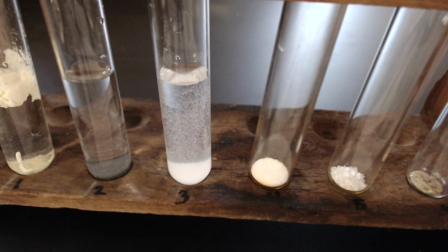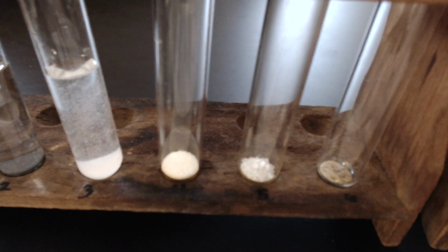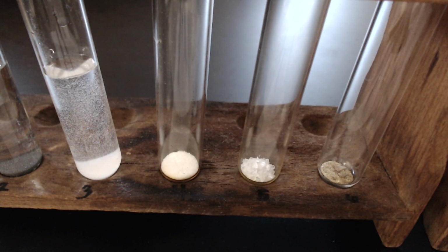Record your data. Chemical number 4, sodium chloride.